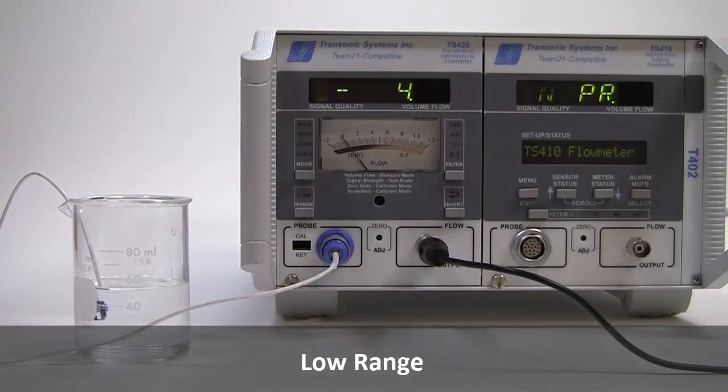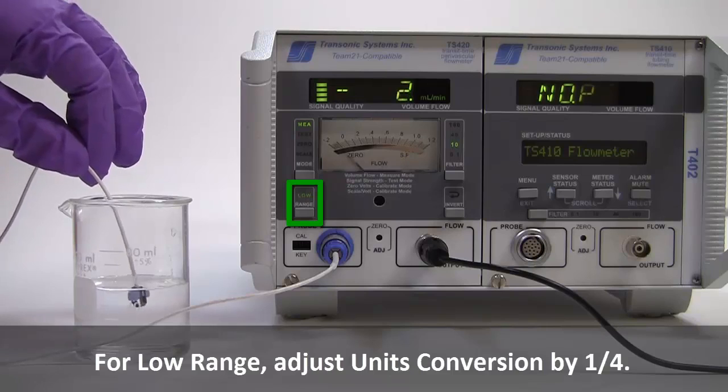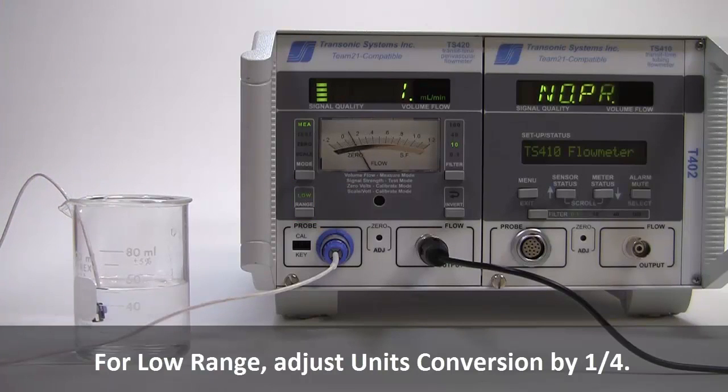And finally, low range reduces the range of the flow probe to a quarter scale to measure lower flow rates when needed. Notice the change in sensitivity. Keep in mind, if you choose to use low range, you will need to adjust your units conversion in LabChart accordingly. For this probe, the low range conversion would be 25 milliliters per minute to 1 volt.